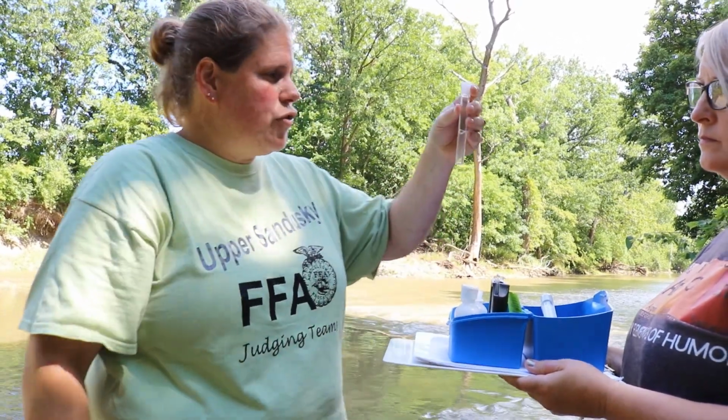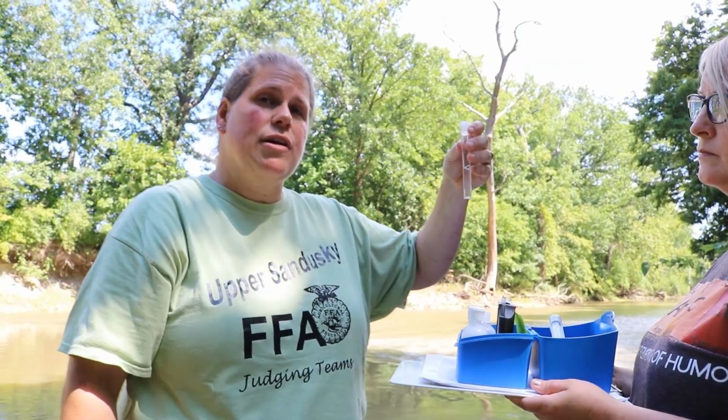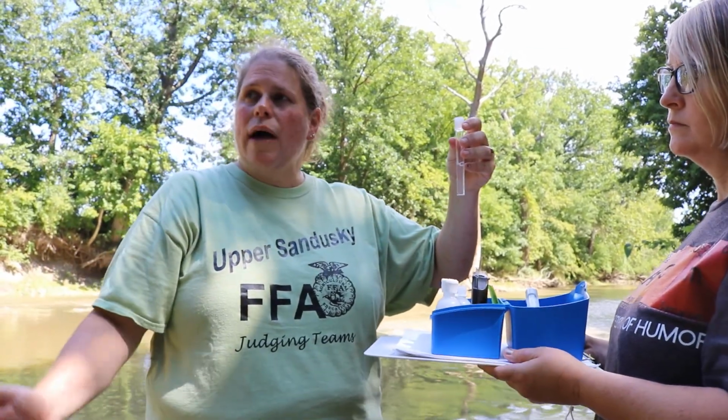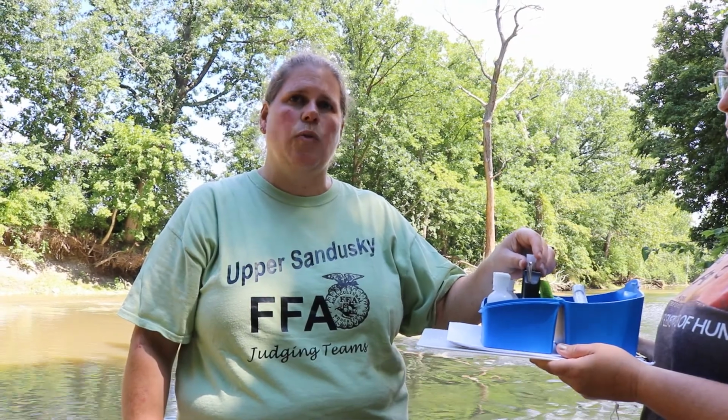Usually if there's a lot of nitrates, you'll see a color change immediately. So we may not have any testable nitrates at this point. We are right down the river from the golf course, so you would think that they've been fertilizing. But being that it's later in the summer, maybe they haven't. And so right now our water could test really, really good and not have nitrates in it. But we can look for signs with algae growth, with scum that's growing on the rocks. There is a little bit of nitrate in here, you can tell just from seeing what's on the bottom. So we'll wait 10 minutes and see what we come up with.